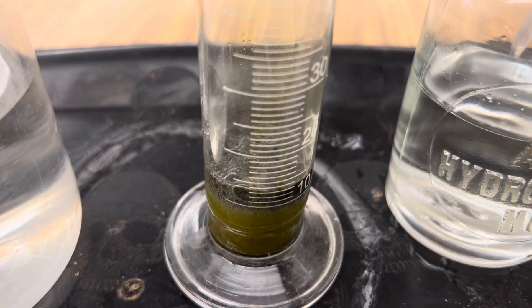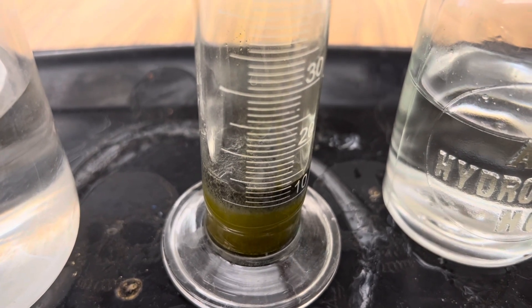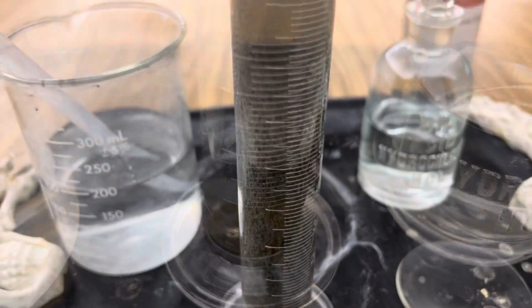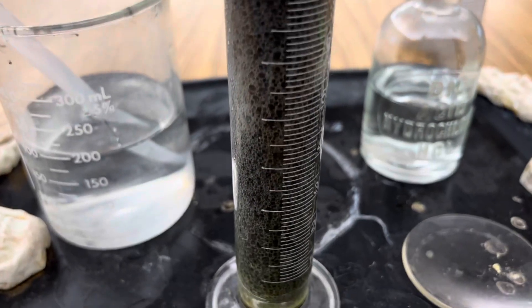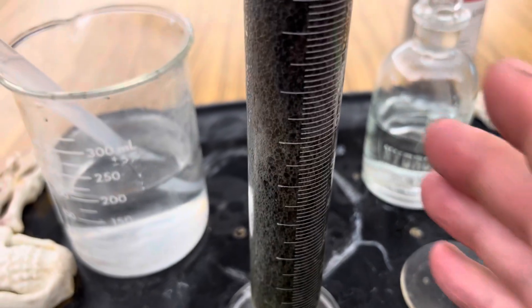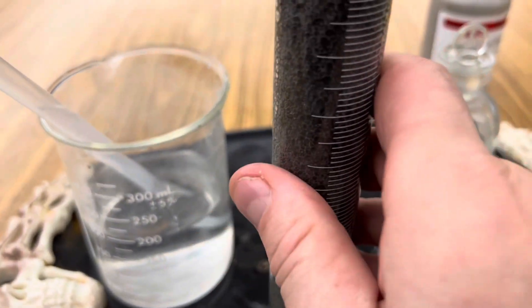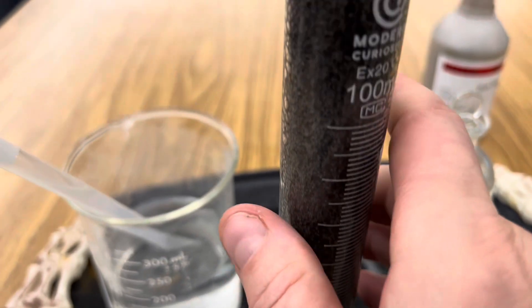I'm going to zoom in so you can really see the reaction. This reaction is definitely exothermic because I can feel heat coming off of it with my hands.